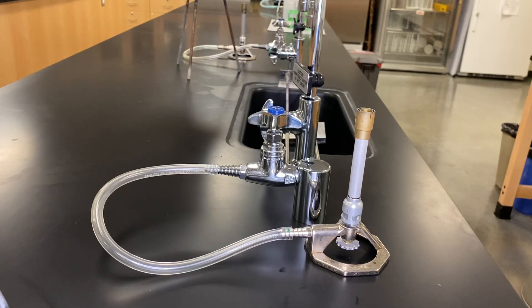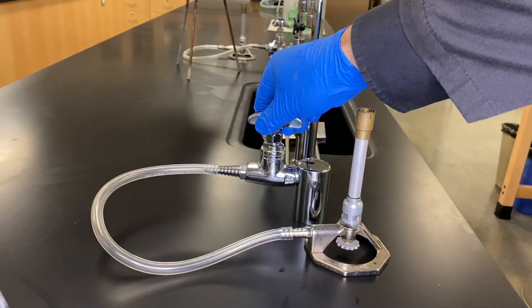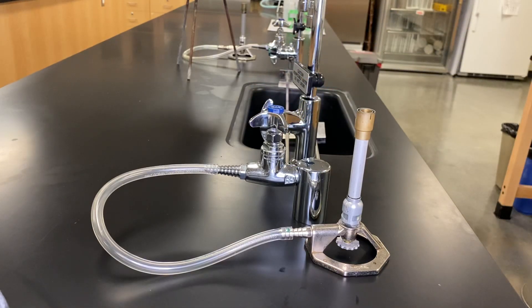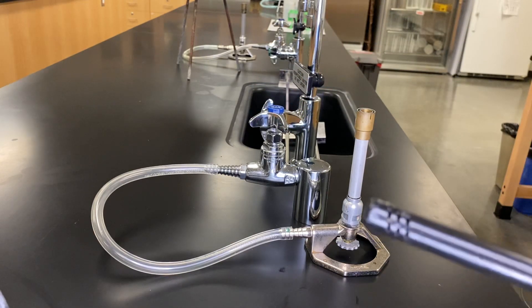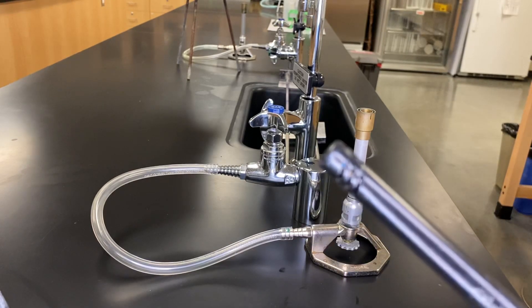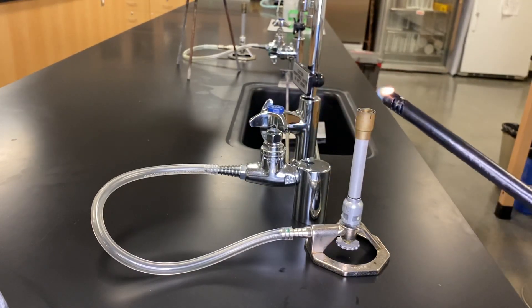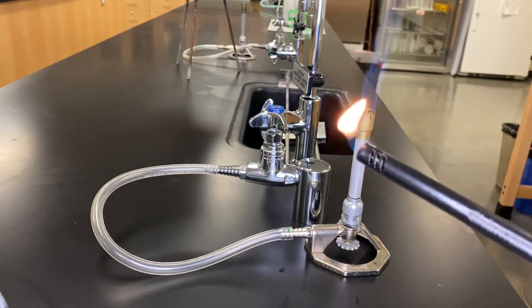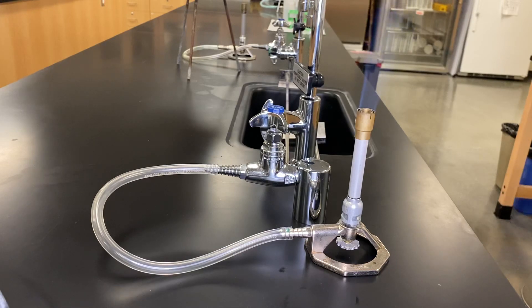And so we're going to use our wand lighter. And the idea behind this is to open up the gas so you can usually hear it, and then make sure you have your wand away from it, that way you can actually have the flame first. So, flame first, and then you can actually touch it. If you try and do the actual clicking over and over over it, it'll just keep on putting it out because a flow of gas is pushed on.